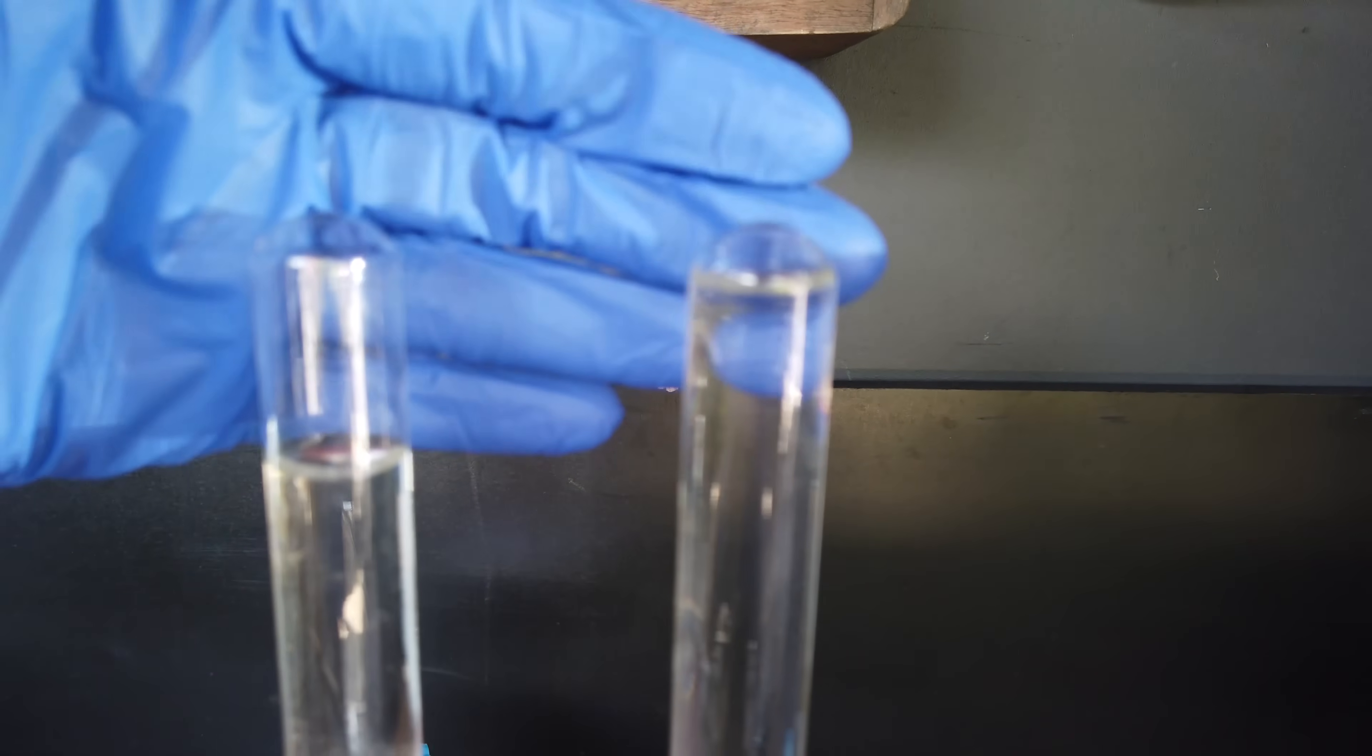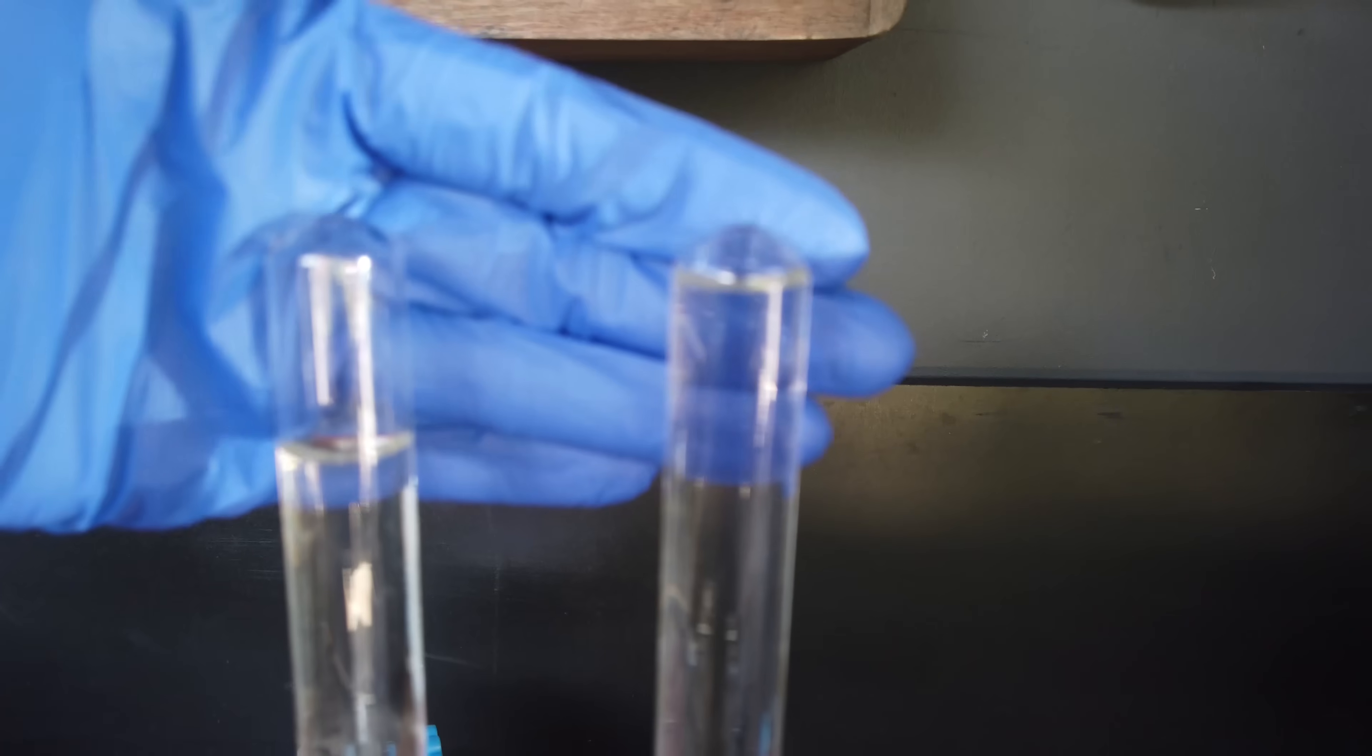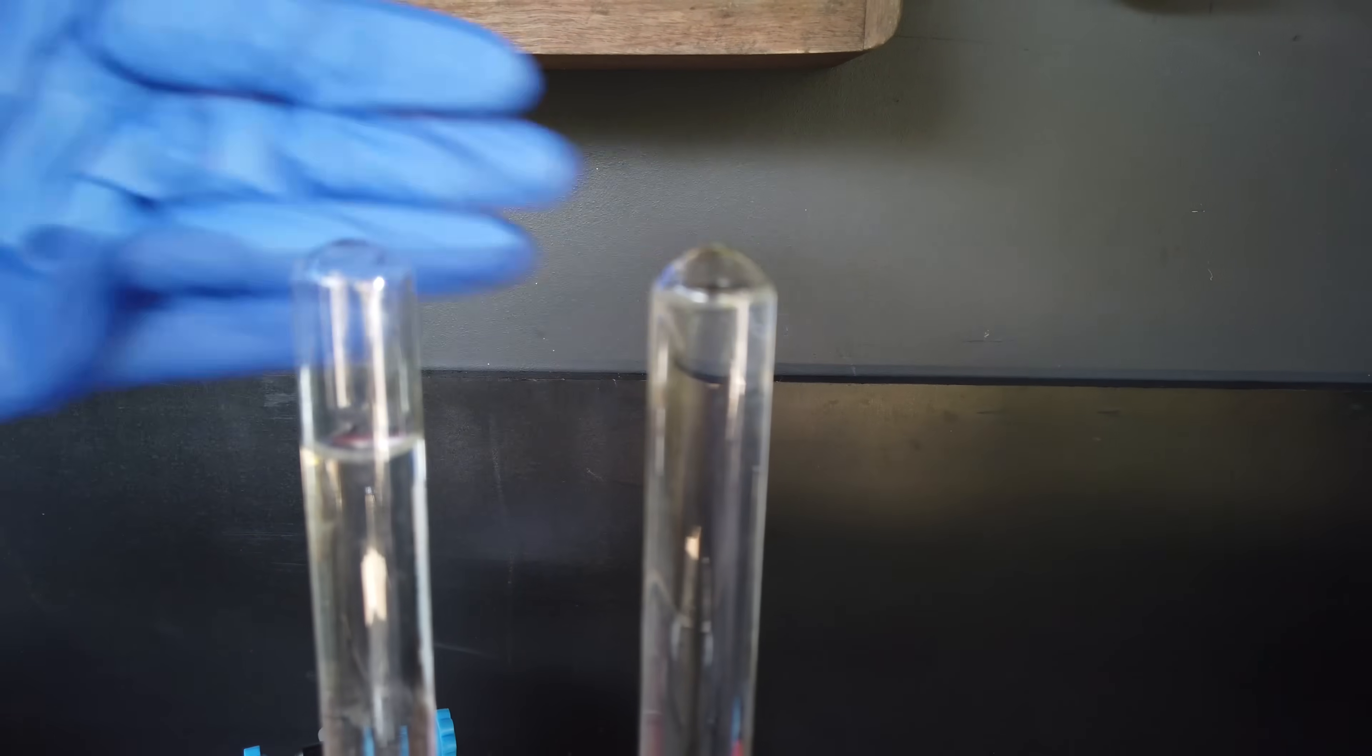I reckon that's less than a milliliter. Amazing.